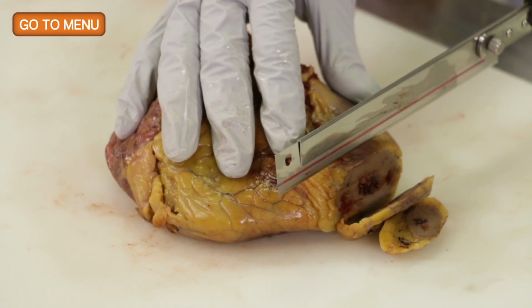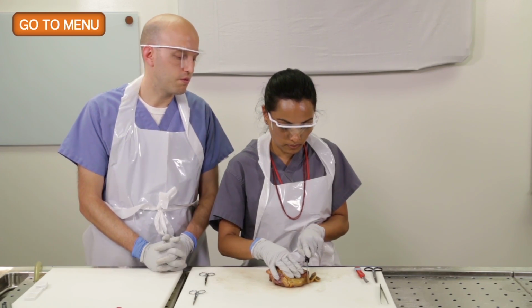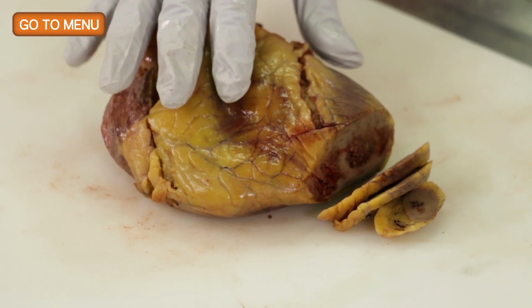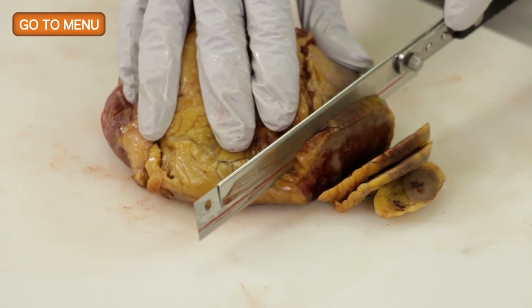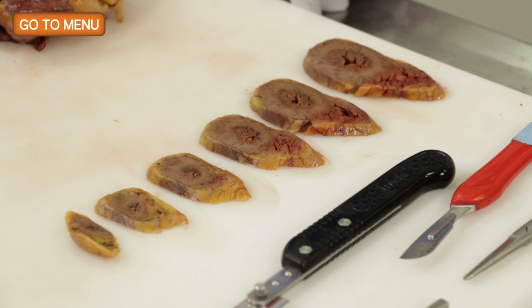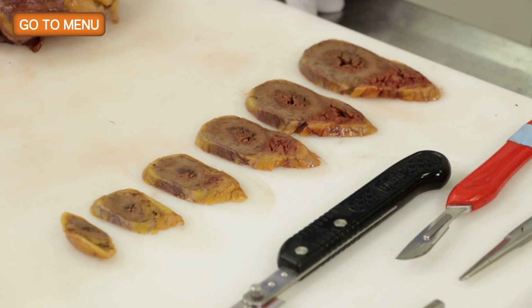In the first sections, unless the patient has congestive heart failure, generally are going to be mostly left ventricle. If the right ventricle is extending all the way to the apex, then typically you're dealing with someone with CHF. So here we have the apex of the heart that's cut very nicely, and we can see both the left ventricle, which is significantly thicker than the right ventricle in most cases.